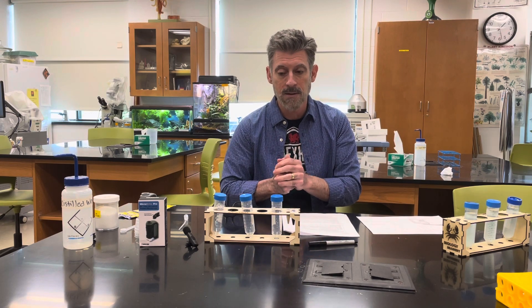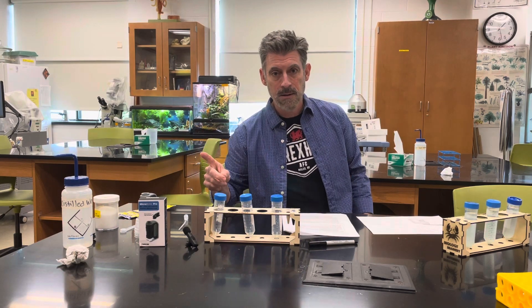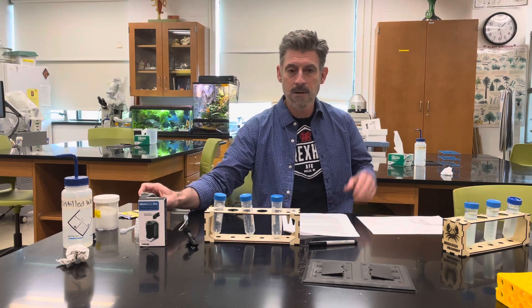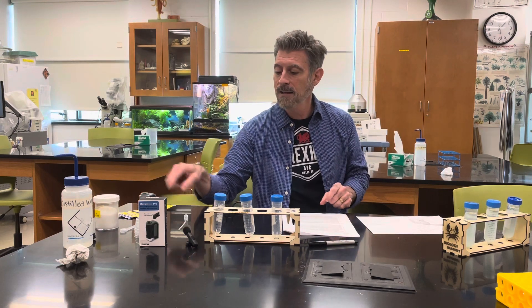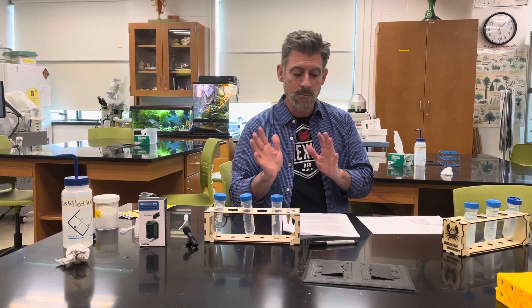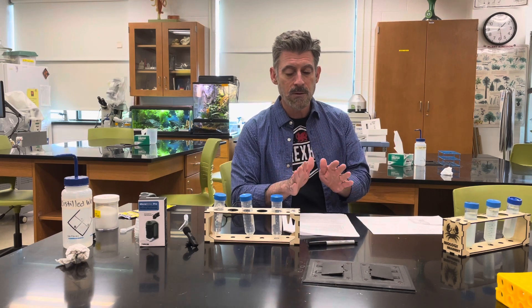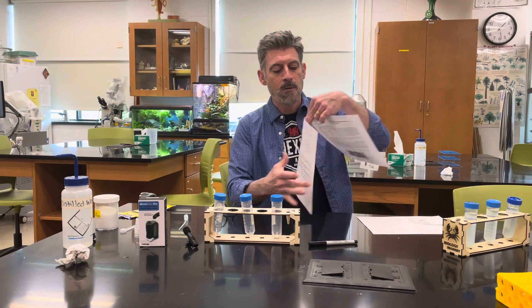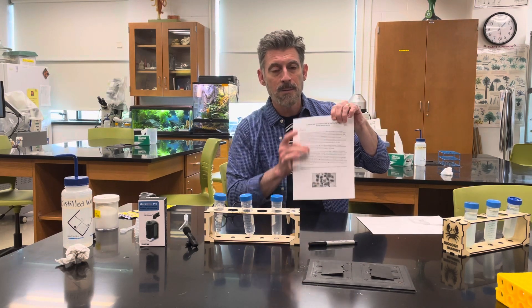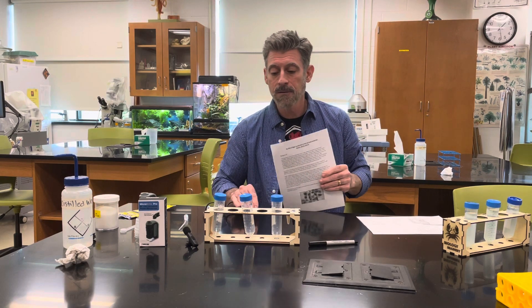There are really two parts to getting this lab going: first is setting it up, and second is collecting the data. You're going to be using your little microscopes, a hemocytometer counting slide, and the little stage with a mirror in it to see and count the cells. That will be a separate set of instructions — this video is just about setting up the experiment. You'll have a written set of instructions as well.